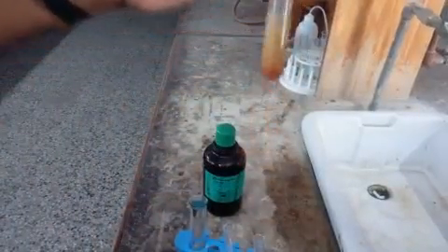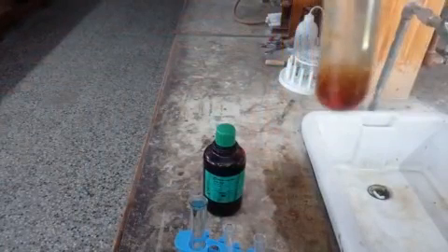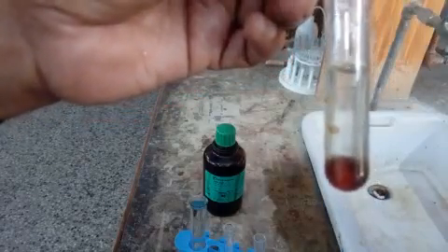I have taken it in a test tube. See, its color is brownish. I have taken water and I am going to mix water. Now see — it is insoluble. It is insoluble. This means organic compounds are not soluble in water.